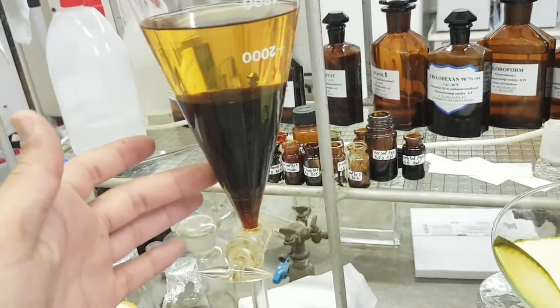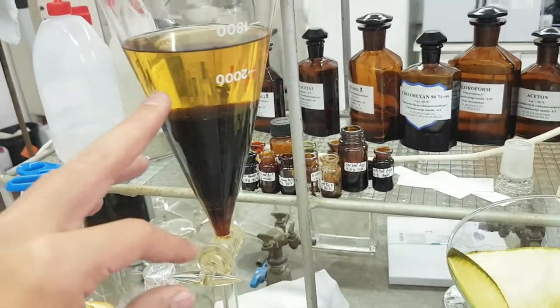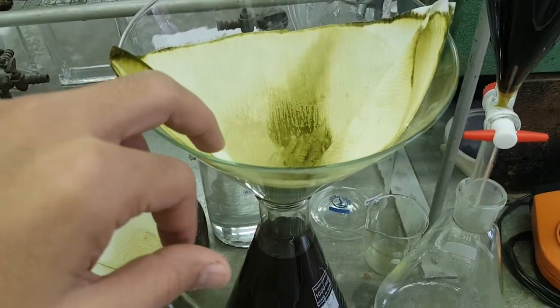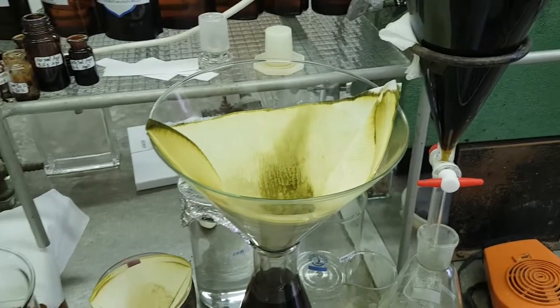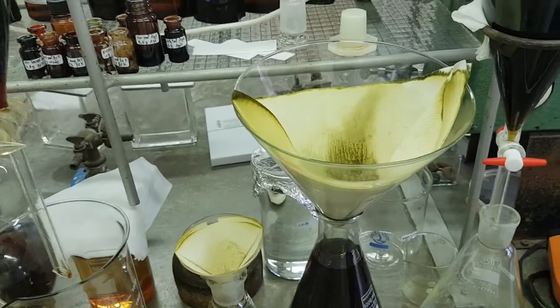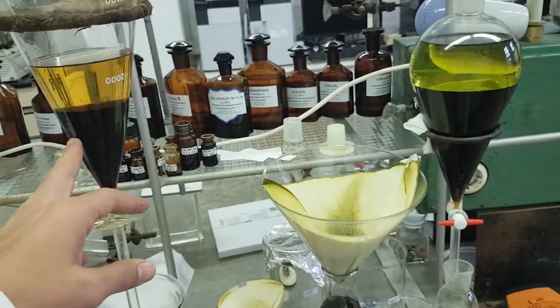For this reason, the part which is not dissolved, I placed it separately and I'm doing the same process. For example, I'm trying here to make a hexane fraction, and in parallel I'm trying to wash these undissolved parts with hexane. Here we are — we recover both parts. This is another approach if you find solubility problems, which is the most commonly encountered issue during isolation and fractionation.